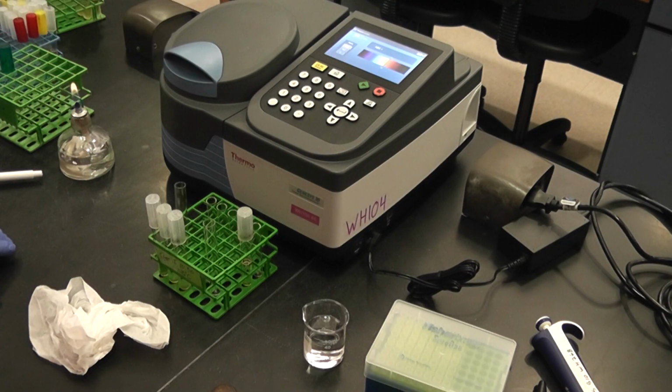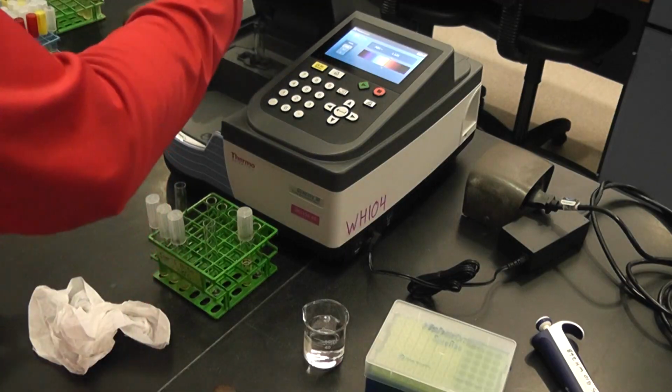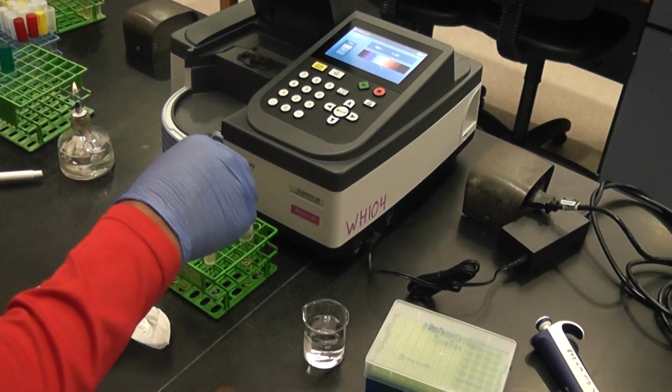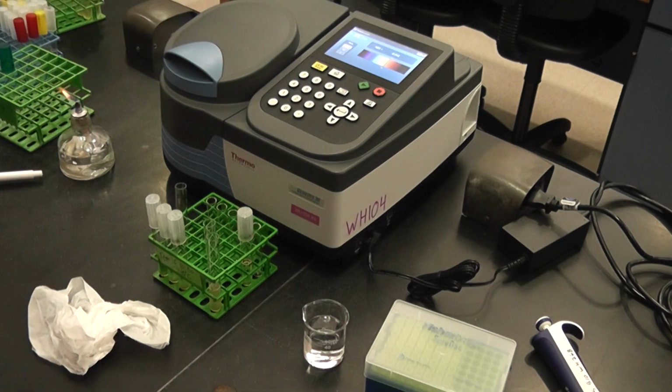So that is too high, but I'm gonna give you the number. So the 24-hour culture reads 1.129. So that is the absorbance. That would be too concentrated for you to run your experiment. You would have to dilute it.